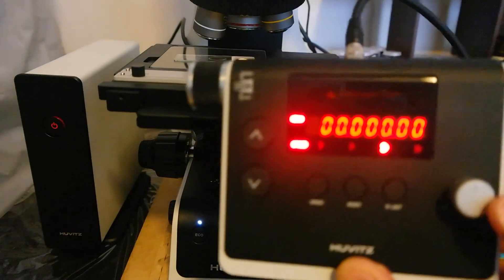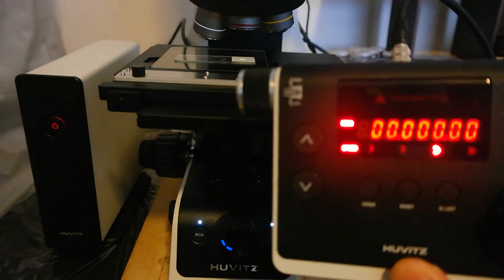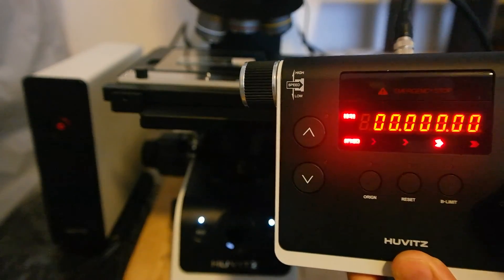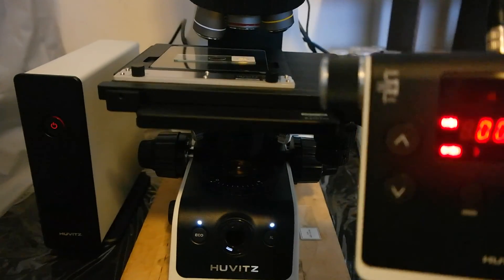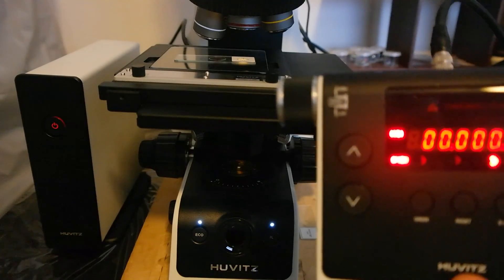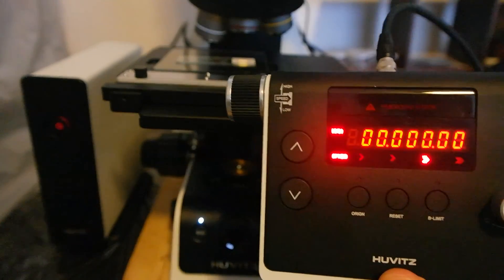And another cool thing here is if you push on this one you would be able to switch between reflected and transmitted light. Since I put that in the hold mode, so basically the light stays on the previously saved level.